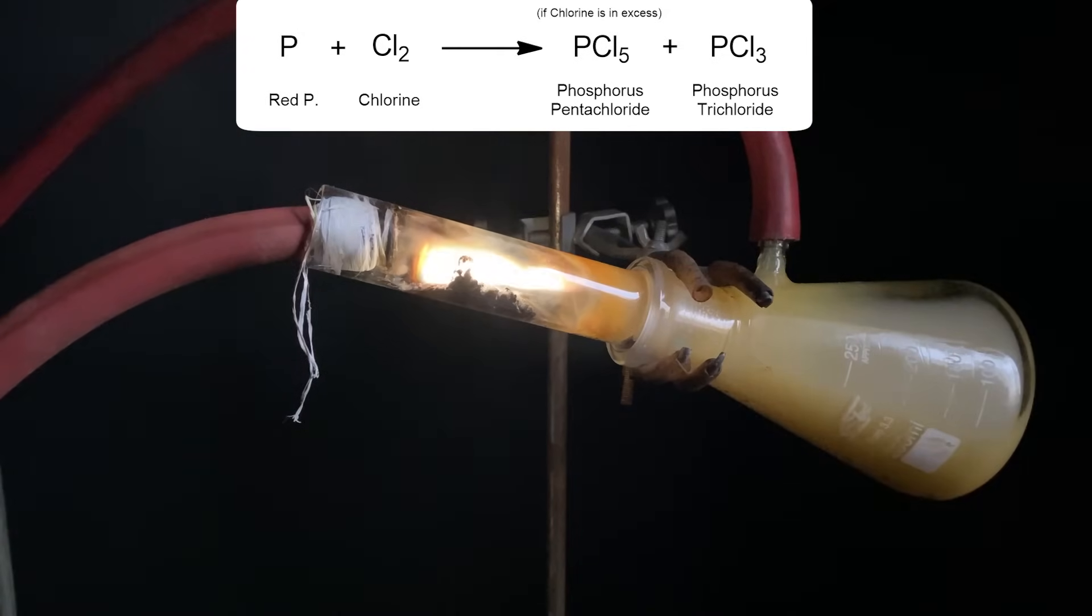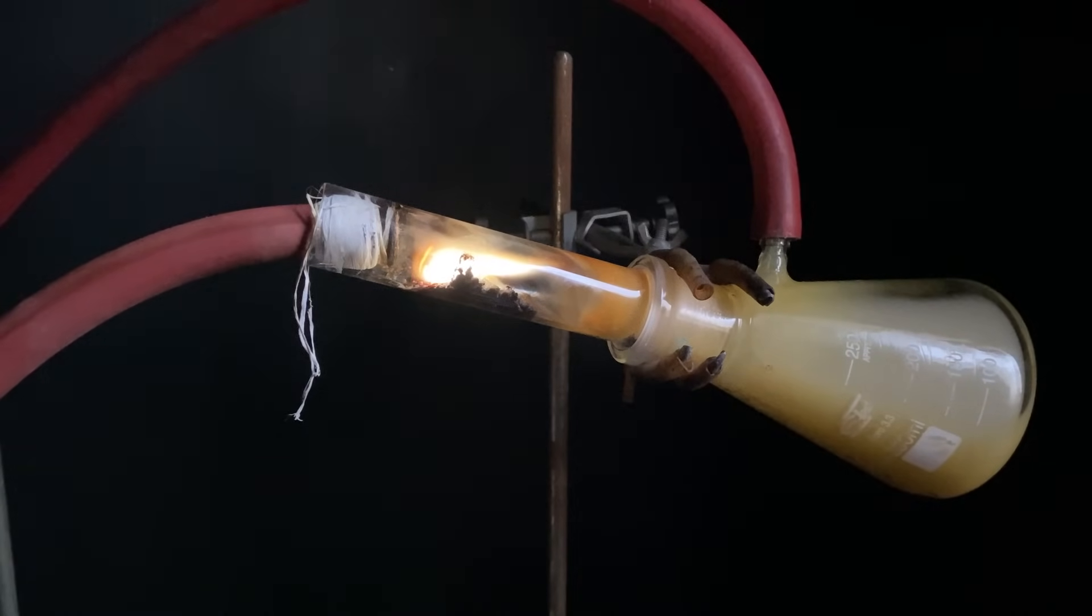Technically, this reaction is called the fusion of the elements, but I'm not gonna call it that, because I personally think that it kinda sounds whack.